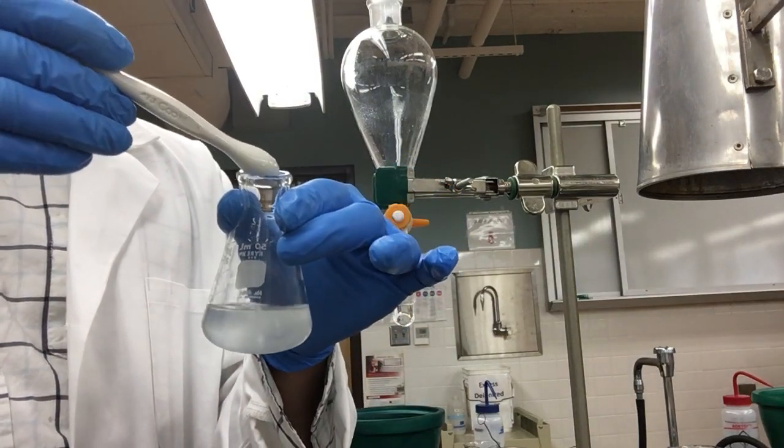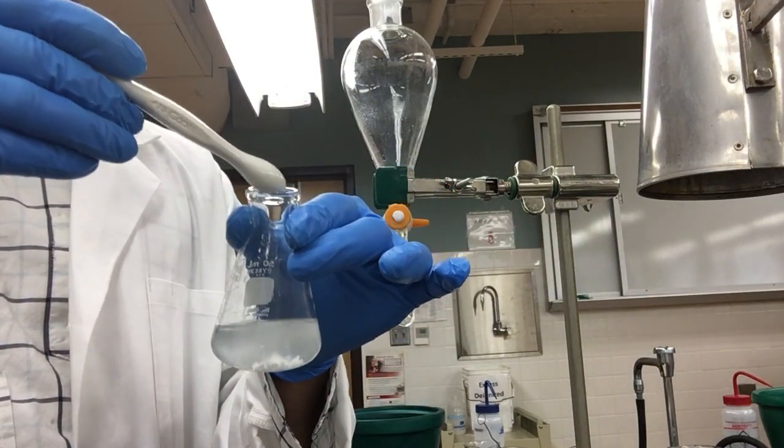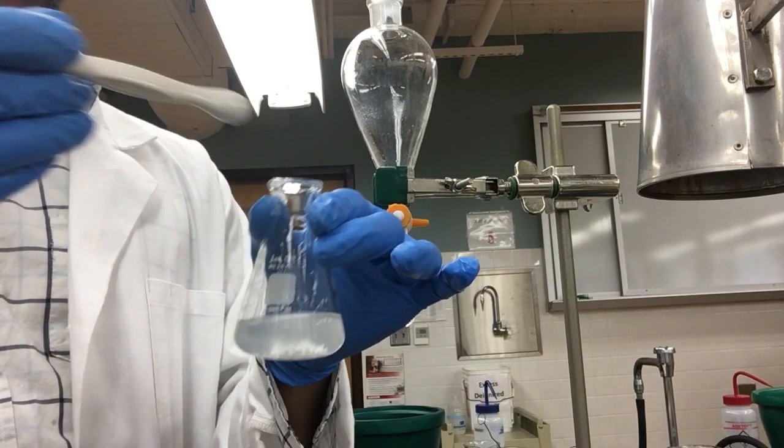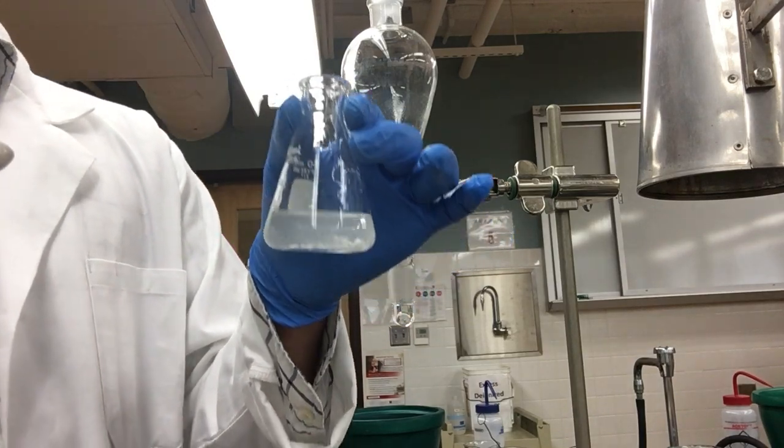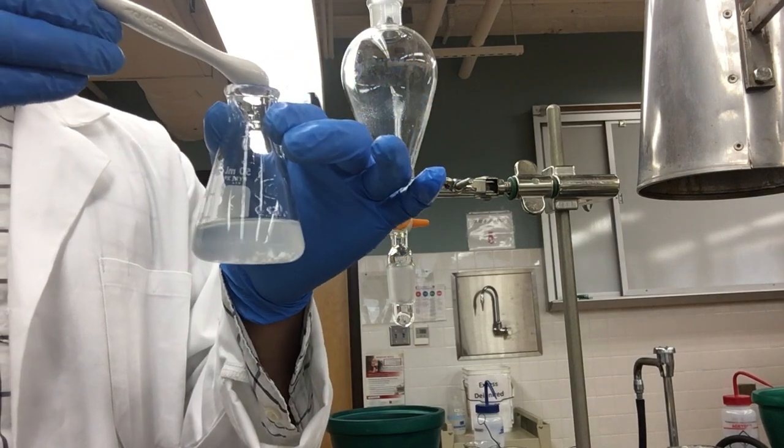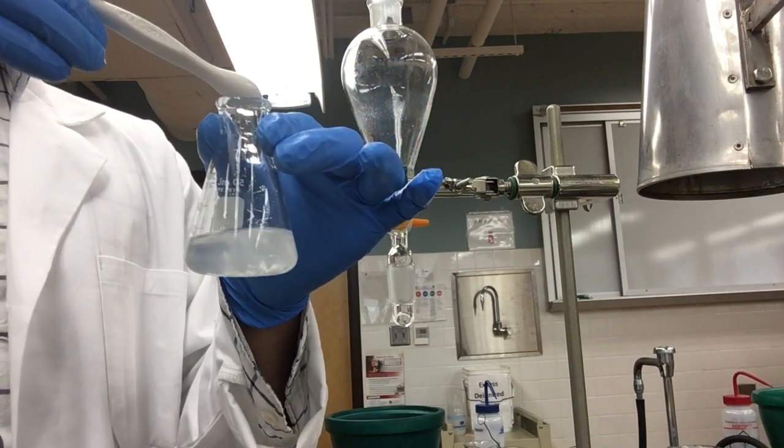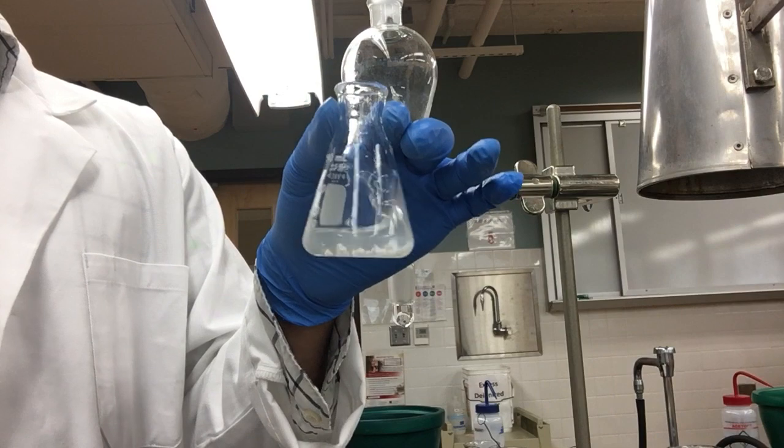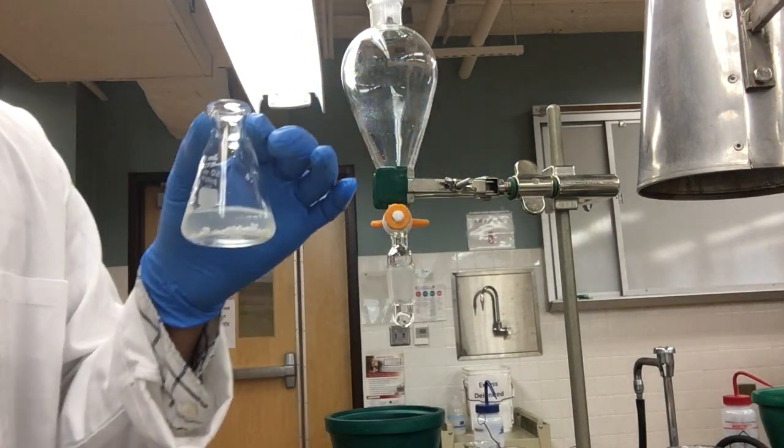We will know that it is working when the solution clears out. If it doesn't clear out in a few minutes, we may have to add more magnesium sulphate.